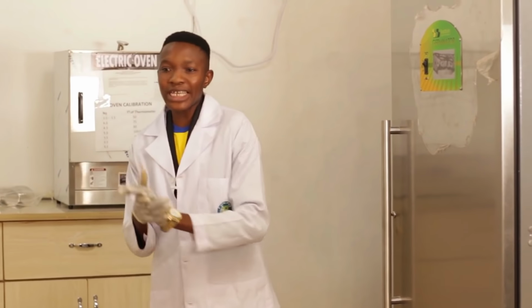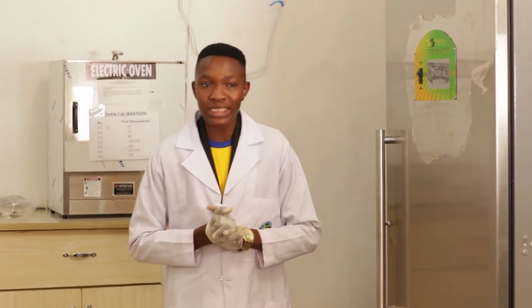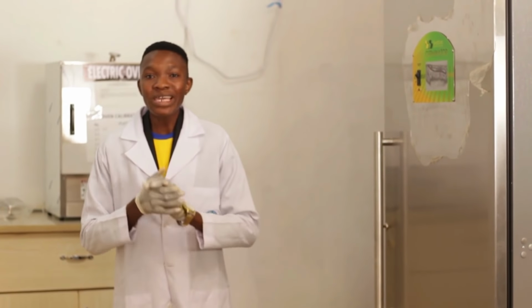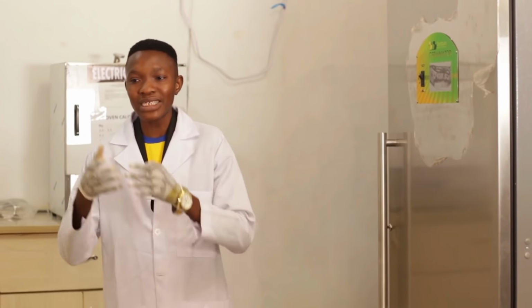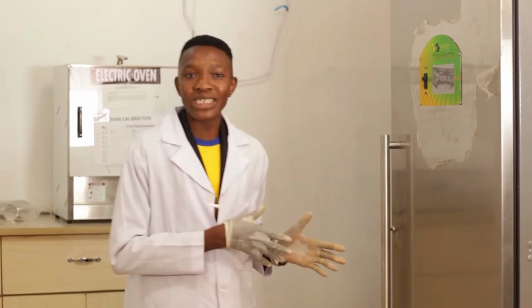You're done with your purity test. And from the pure seeds, you select 400 seeds. Remember, in your selection, you should not be biased. There are criteria that make a seed qualify to be a pure seed. So, in your selection from the pure seed, you should not be biased, maybe stating that this particular seed will germinate or the other will not germinate. You select pure seeds and allow the germination test to tell you the result.